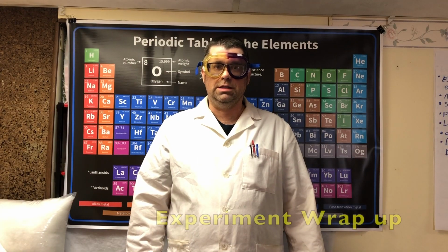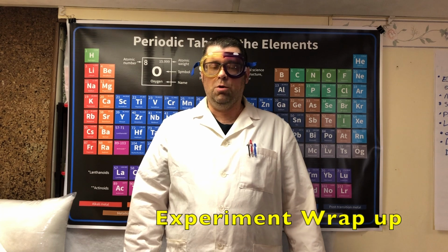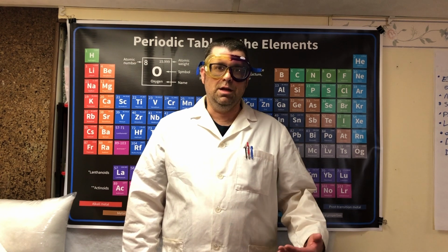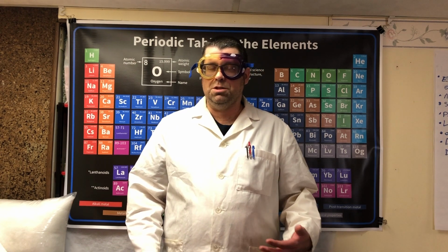Alright, that was a lot of tests that were performed, but hopefully this gives you a better idea of what kind of bonds were in those substances. Now, remember, as you observe some of the properties and reflect back at your data, you might notice that some of the properties kind of overlap. One of the crystalline substances had a very low melting point compared to other substances of its type. So when you make a final decision as to what kind of bonds there are, consider that there might be one or two properties that don't quite match up.